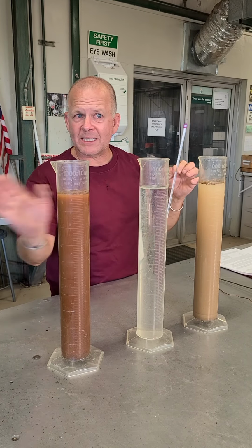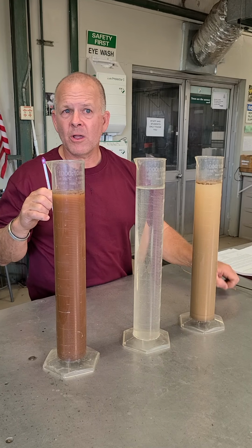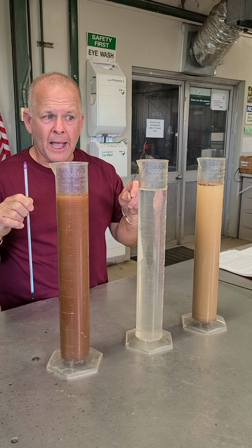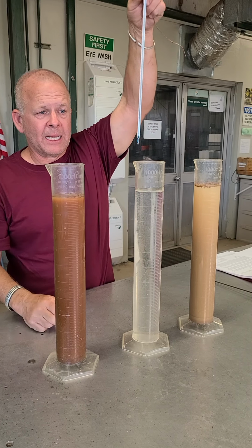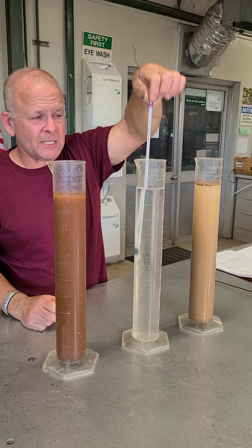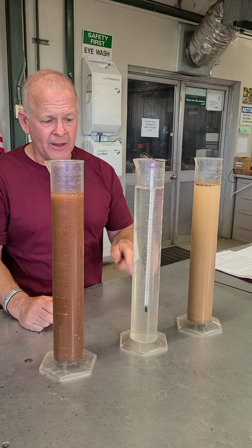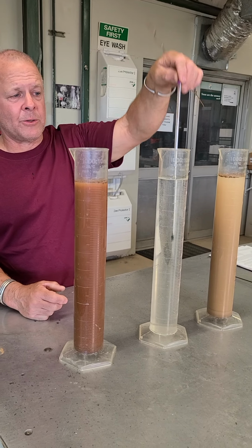Now these have all been sitting here at the same time. The water in them is all the same source, so we know they're all the same temperature. I can go ahead and put this in like this. I'm going to suspend it like this. I'm going to do this afterwards, but this is what I'm going to eventually do. You'll see I just got this piece of wire there just so it can hang there, and I can actually read the temperature in that one. I'm not quite ready to do that one yet.